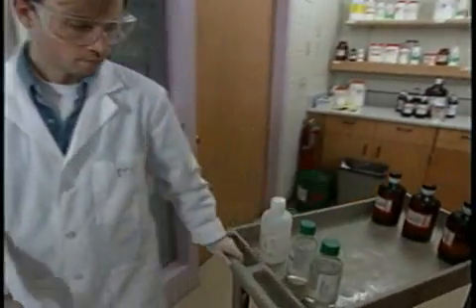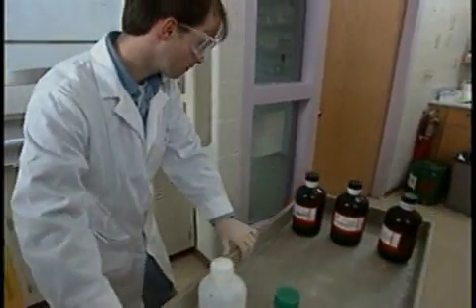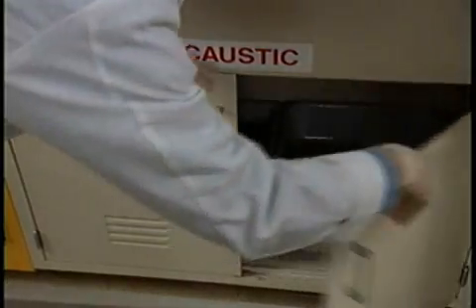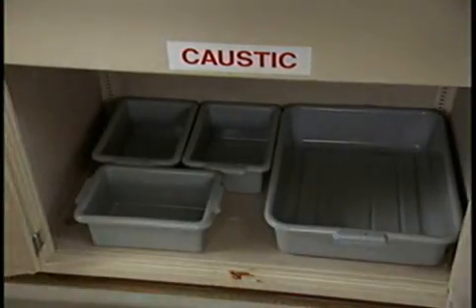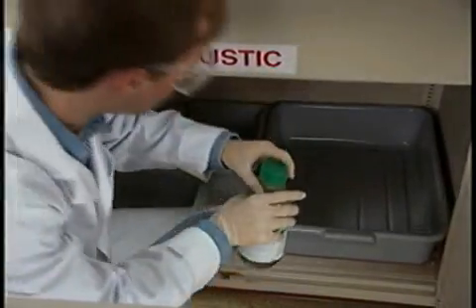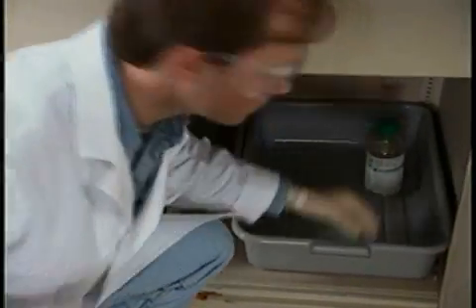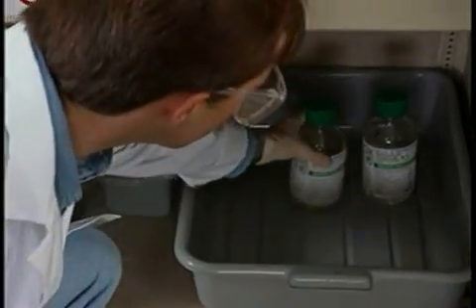Lisa and Mario have arranged a separate storage area for caustics. But even within this cabinet, they store different types of caustics apart from each other, and in plastic trays that will catch any spill or leakage.